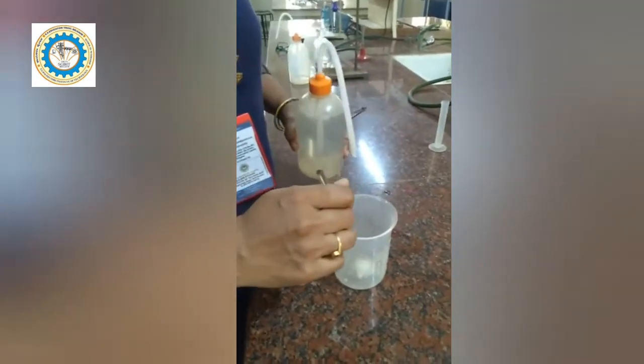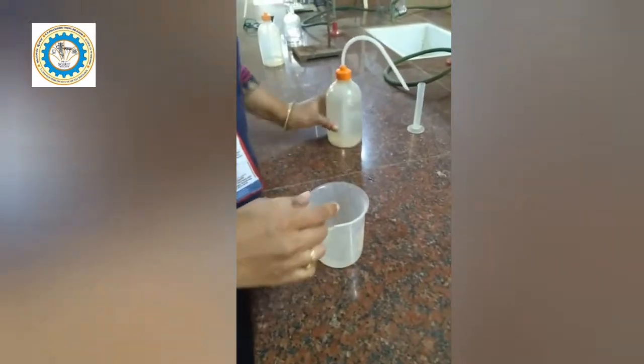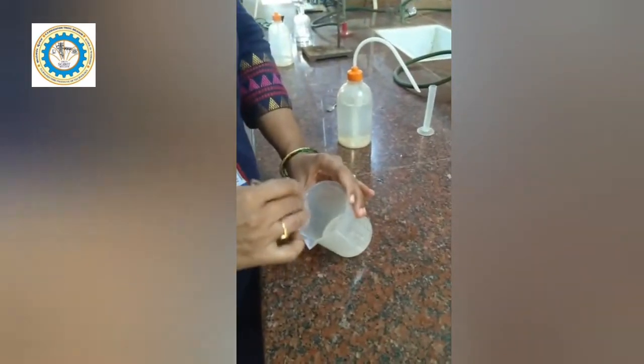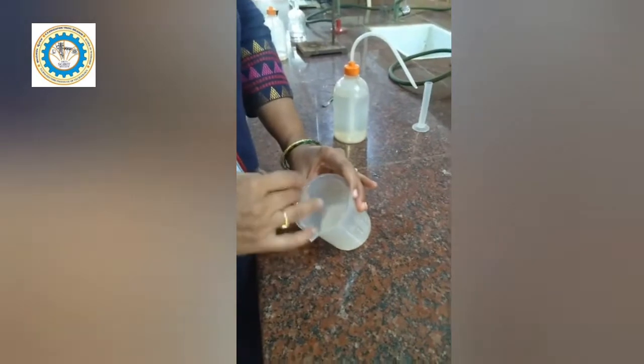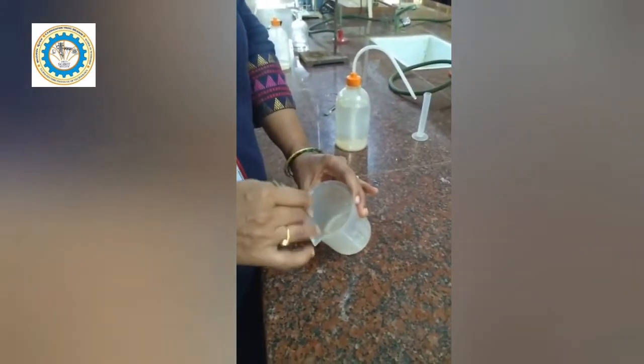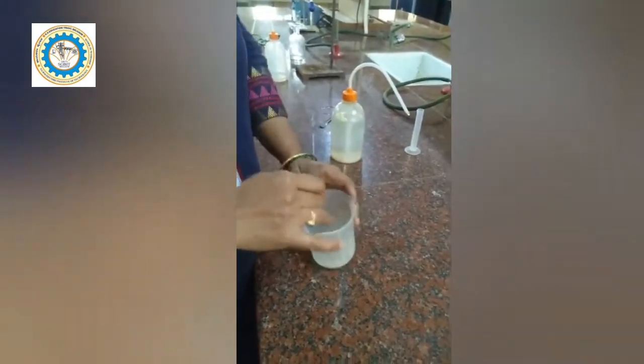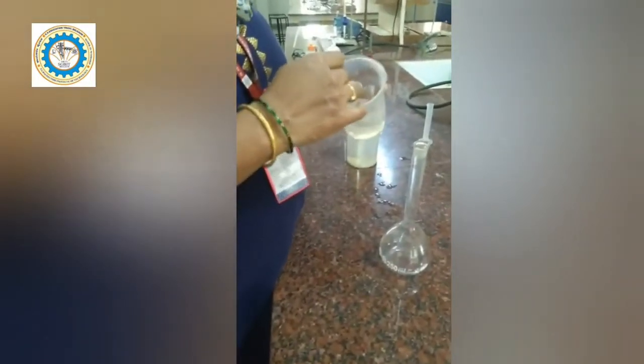Now we are going to prepare a standard solution. A weighed quantity of EDTA is taken in a beaker. To that we are going to add a minimum quantity of water. With the help of a glass rod, stir the solution. Transfer this solution into a volumetric flask with the help of a glass rod.